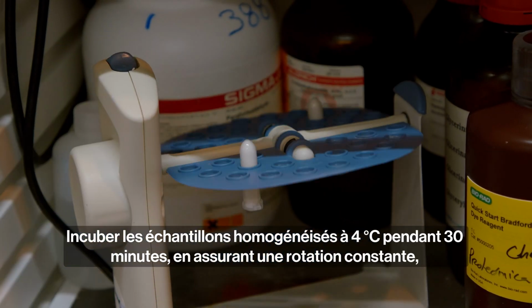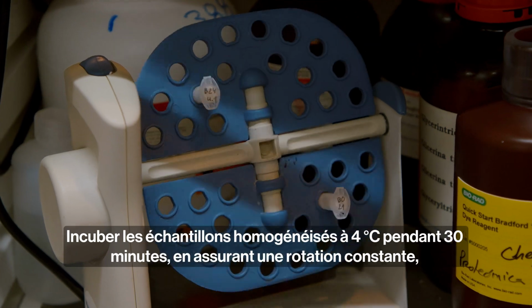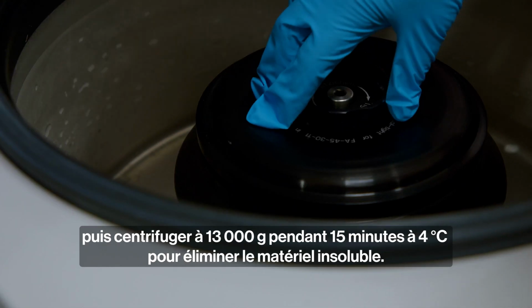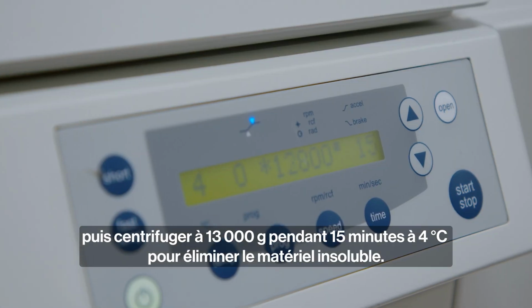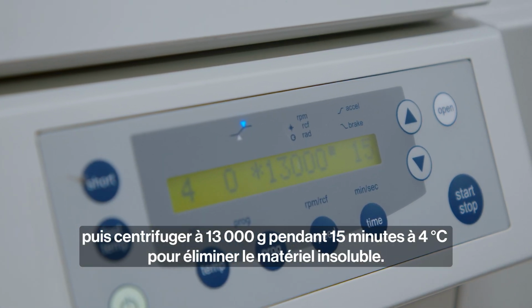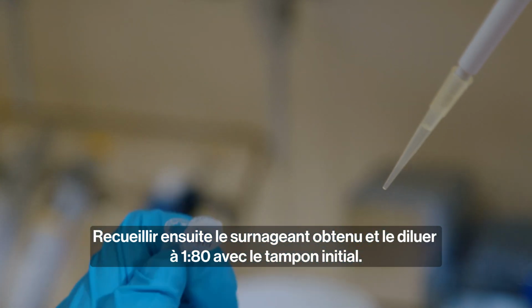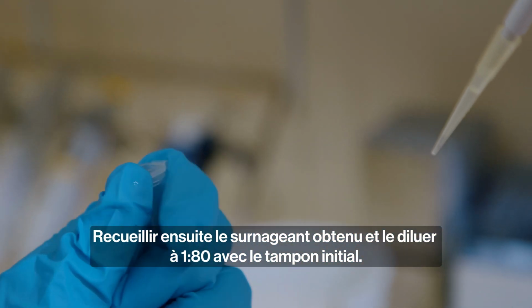Incubate the homogenized samples at 4 degrees for 30 minutes in constant rotation and centrifuge at 13,000 Gs for 15 minutes at 4 degrees to remove insoluble material. Then, collect the resulting supernatant and dilute 1:80 with the initial buffer.